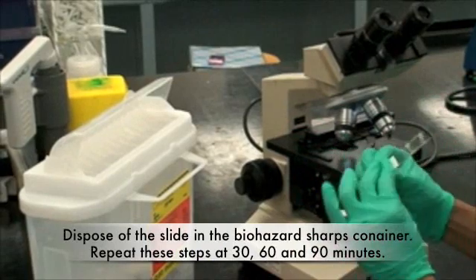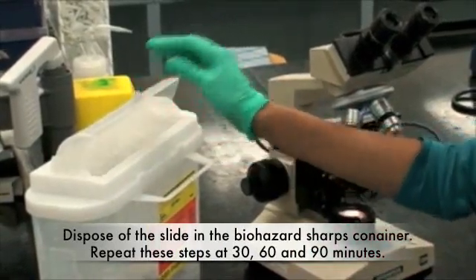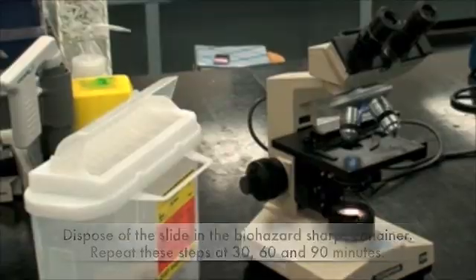Lastly, dispose of the slide in the biohazard sharps container. Repeat these steps at 30, 60, and 90 minutes.